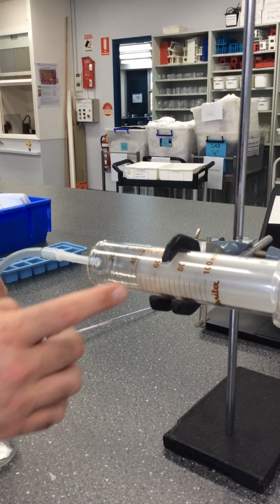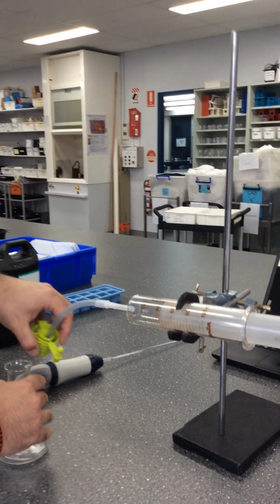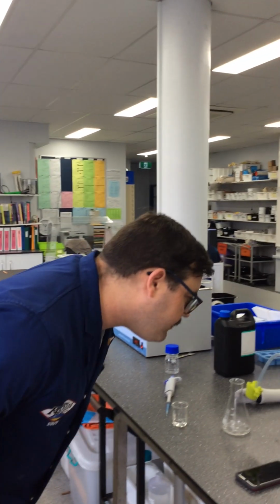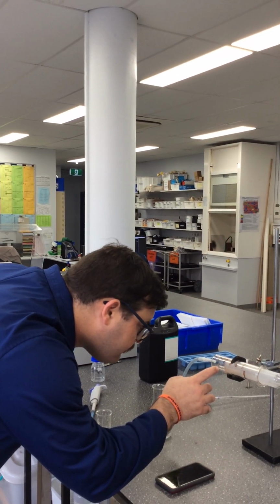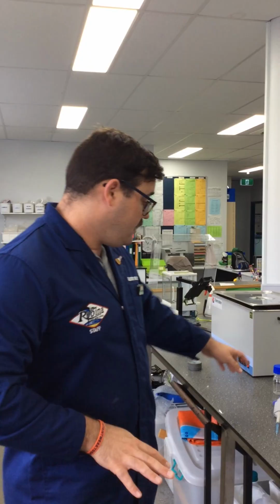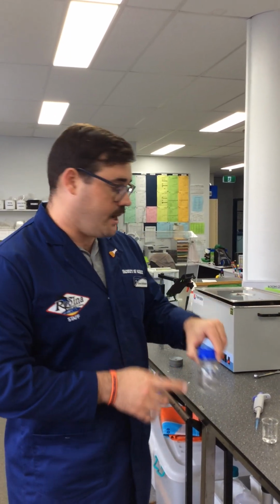Okay, now each of these is actually 4 mils. So just before 40 means that it was at 36 mils. Okay, so 36 mils gives us... actually, am I right there? 4, 8, 12, yep, 36, sorry, 36 mils. So we produced 36 mils in 30 seconds there with room temperature, 3% hydrogen peroxide, and a 1% Catalase solution.